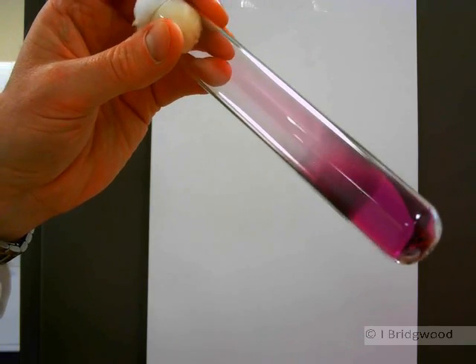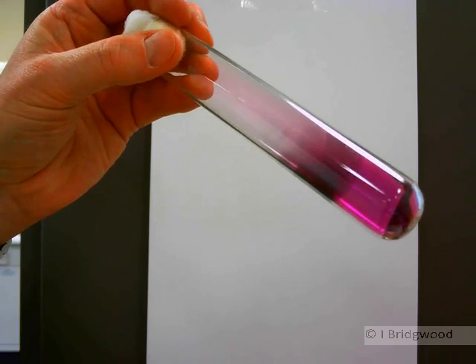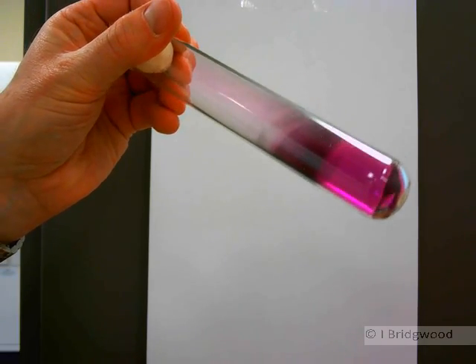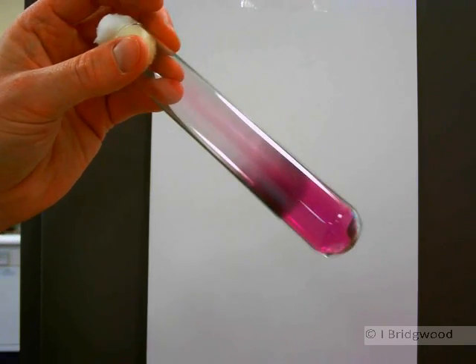So it's moving from the gaseous phase into the solid phase without going through the liquid phase there. Thank you very much.